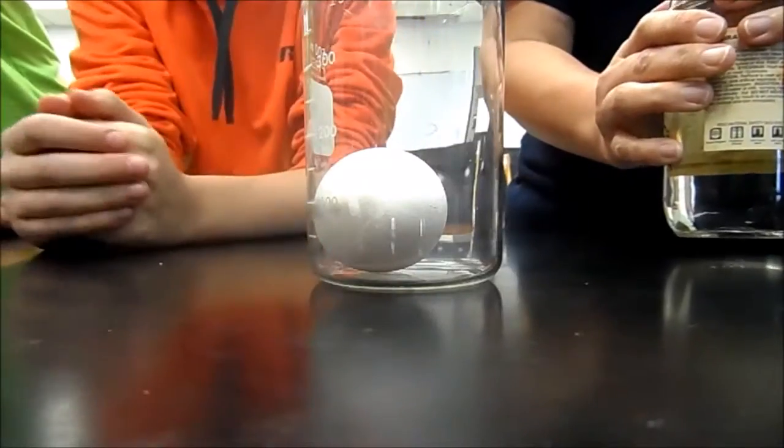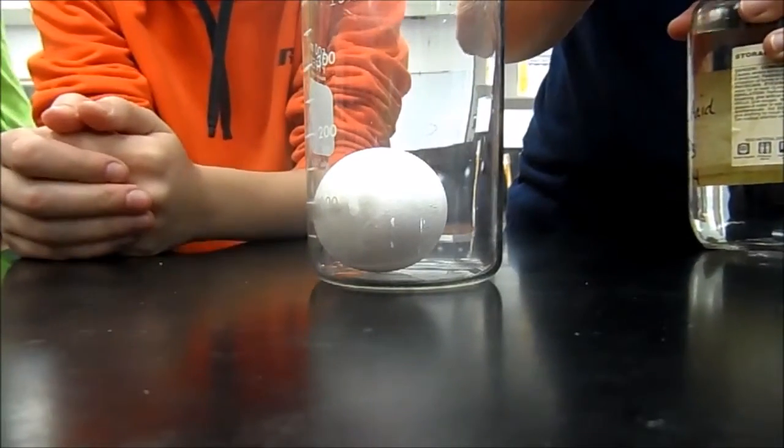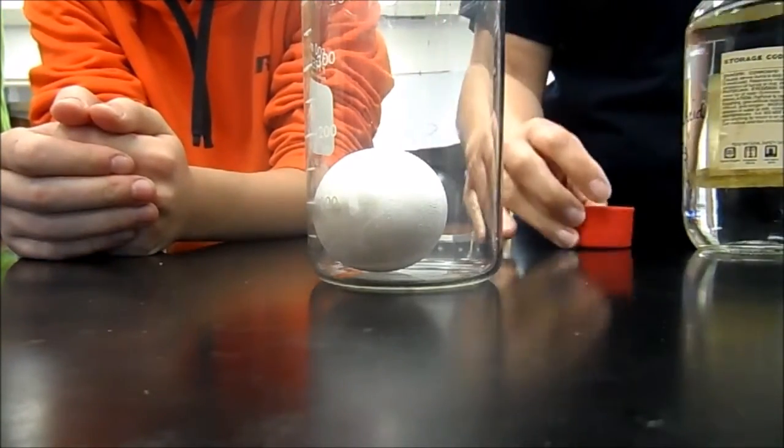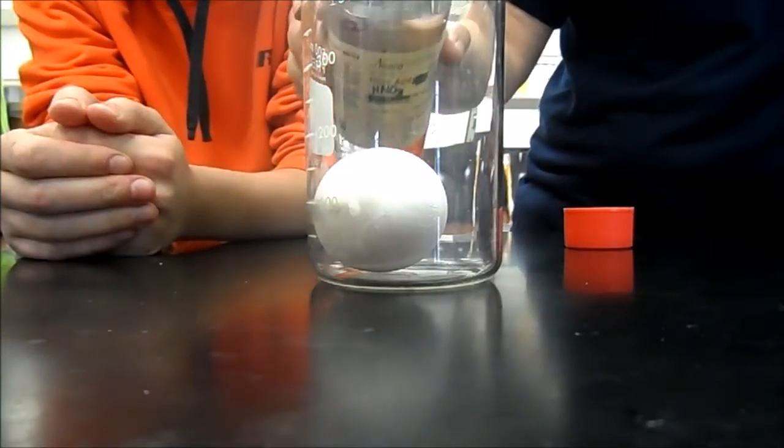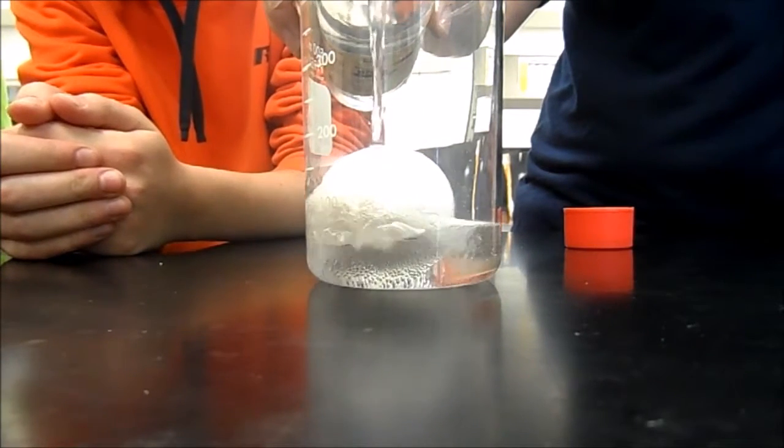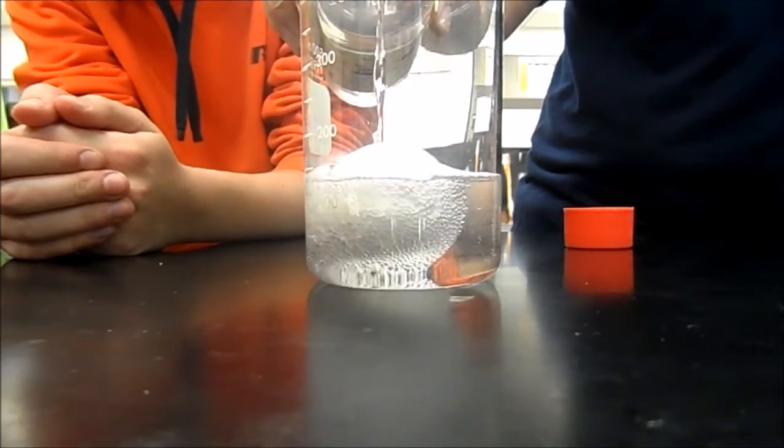The egg has calcium carbonate in it, and so that nitric acid is going to react with the calcium carbonate. Nitric acid on the egg, here we go. Whoa, it's actually kind of cool.